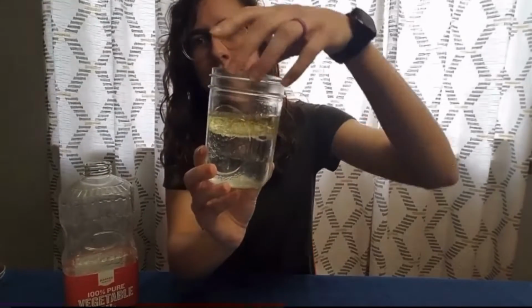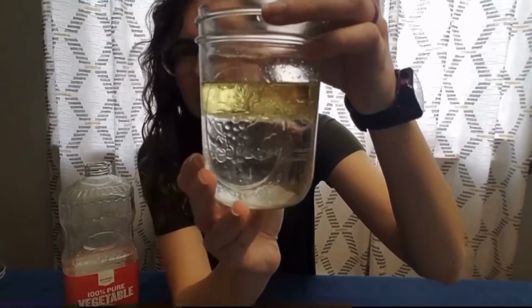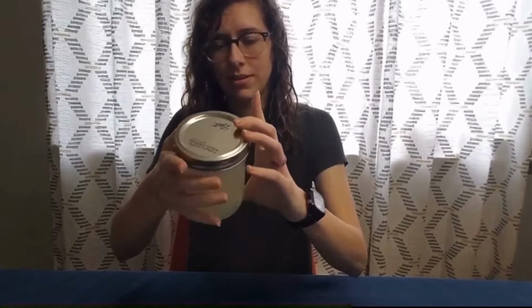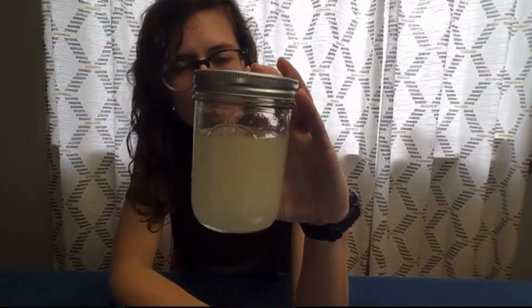You guys see what happened? Did it mix? No? Oh, that kind of looked like it worked. Let's watch and see. Separate.